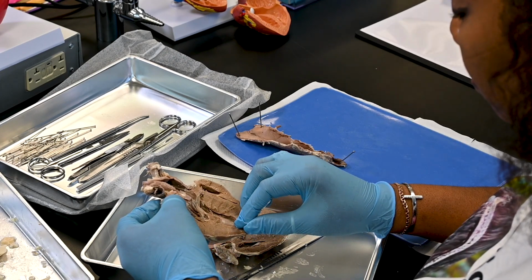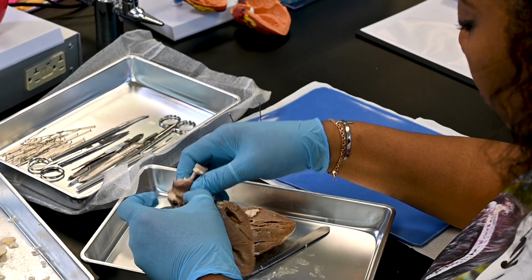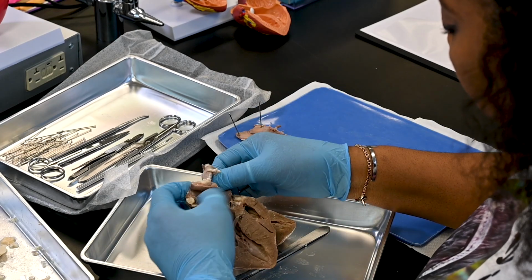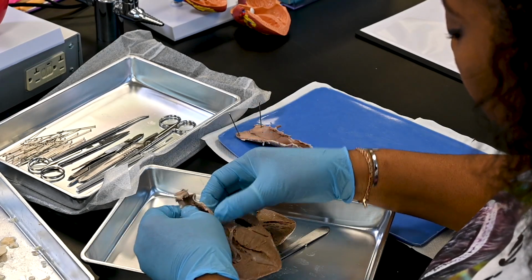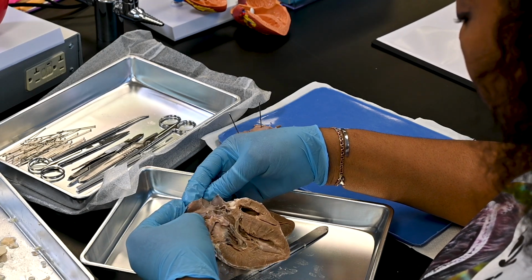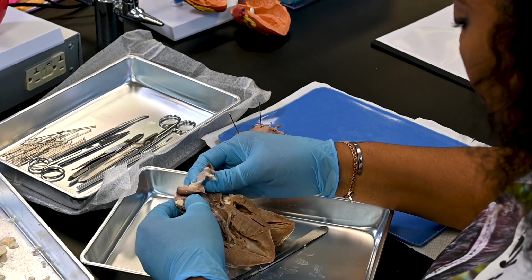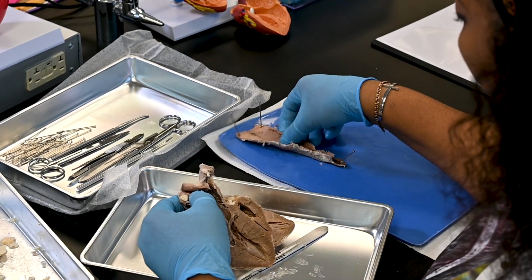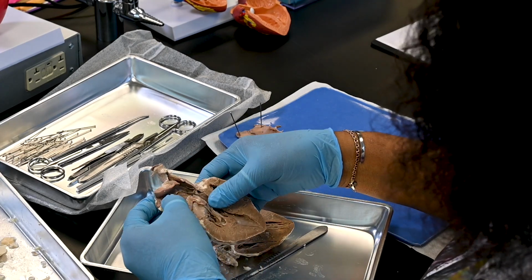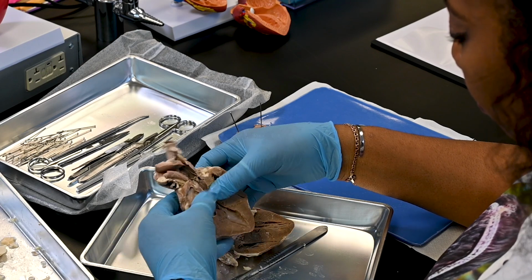Gently pull on the aorta with your gloved fingers or forceps to stretch it. And repeat that with the vena cava. Which vessel is easier to stretch? And how does the elasticity of each vessel relate to its ability to withstand pressure?